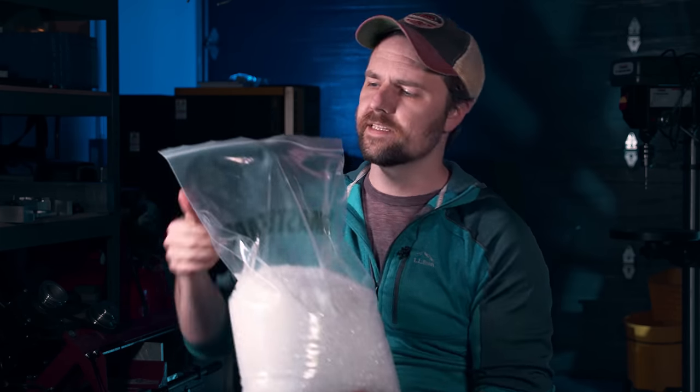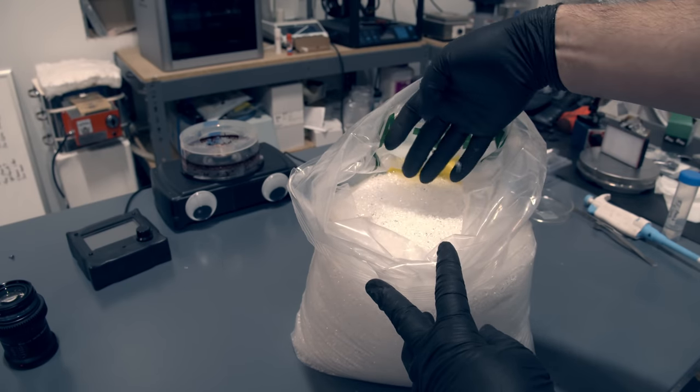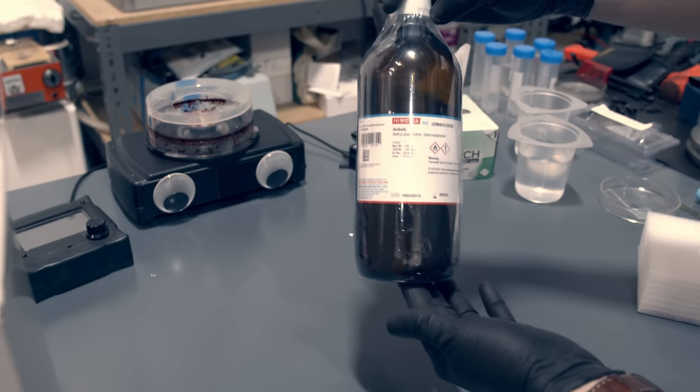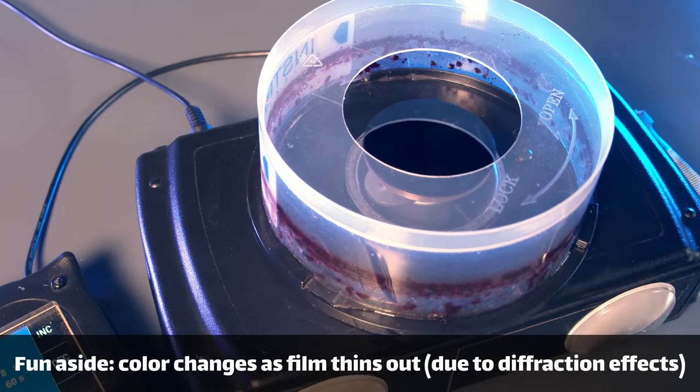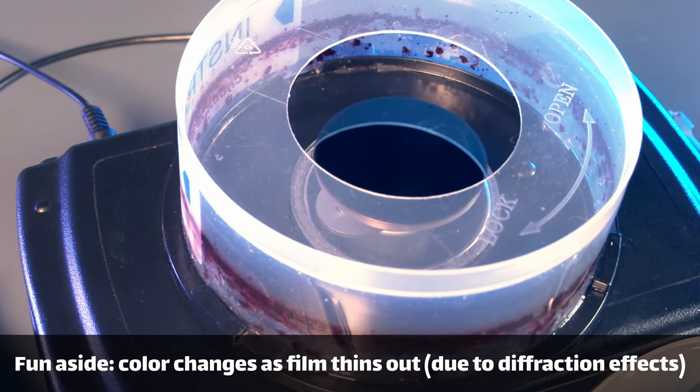The resist I'm using is PMMA — polymethylmethacrylate — more commonly known as acrylic plastic. I'm using injection molding resin beads dissolved at 5% in anisole, dropped onto the wafer on a spin coater, and spun out at a particular RPM to get the desired thickness. Running the spin coater at its max speed of 5,000 RPM gives me a surface layer of about 200 nanometers.